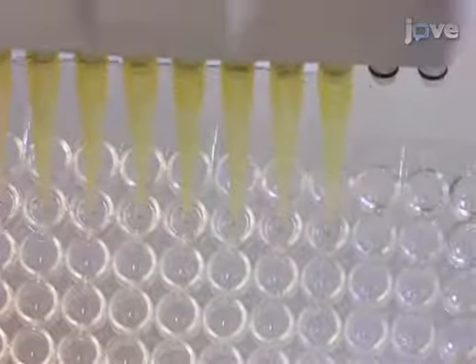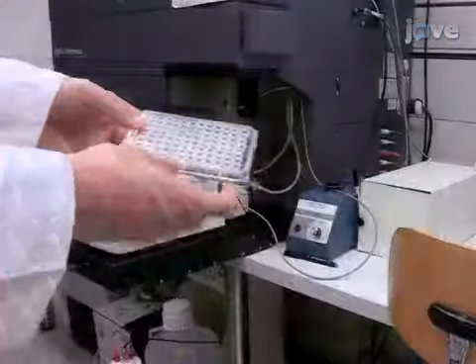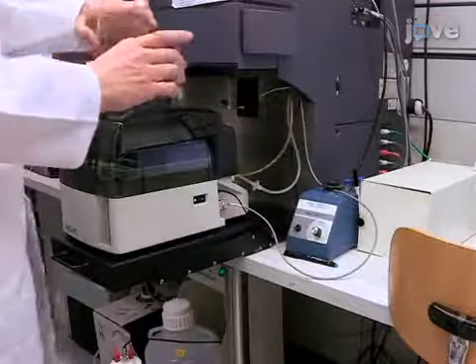There is the risk of losing a lot of cells during the fixation and staining procedure due to the multiple washing steps. To avoid loss, make sure to take off the supernatant right after centrifugation without disturbing the pellet with a pipette tip. After the cells have been stained, wash the cells twice in PBS and analyze them on a flow cytometer.